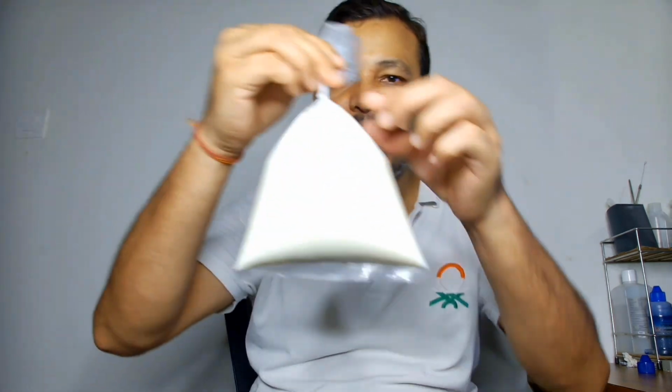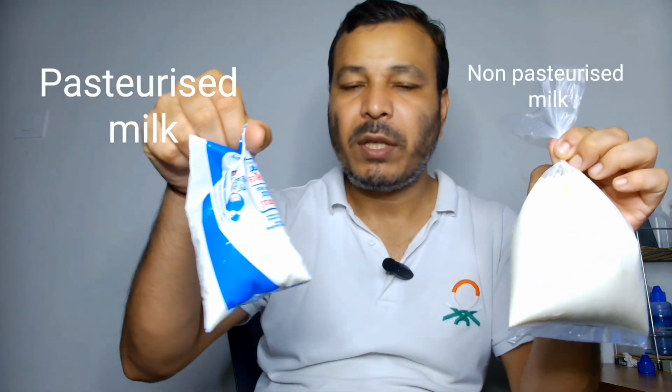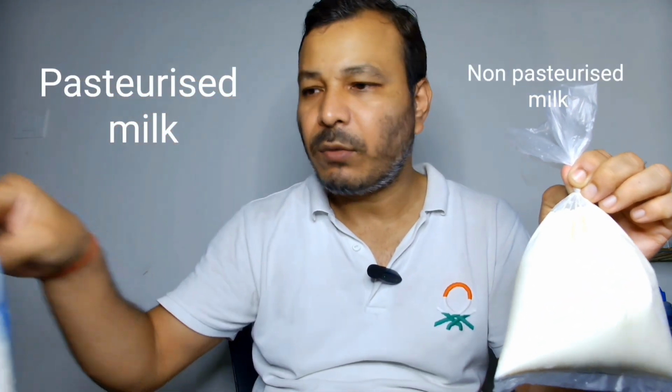For that, we have this dye. We have two milk samples with us. This is non-pasteurized from the local dairy farm, and this is from Amul, which is the pasteurized one. We'll take 10 ml of both the samples.